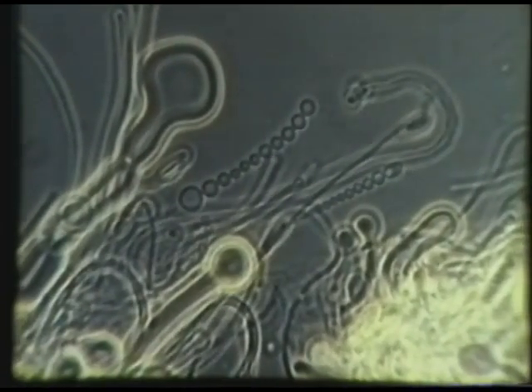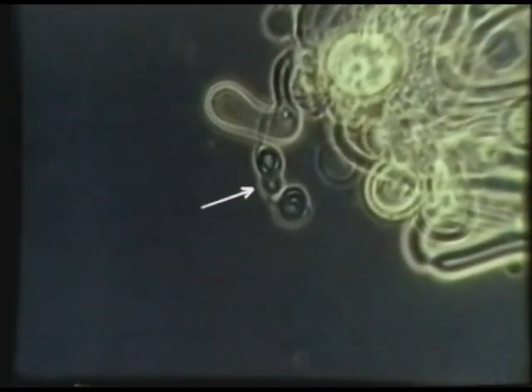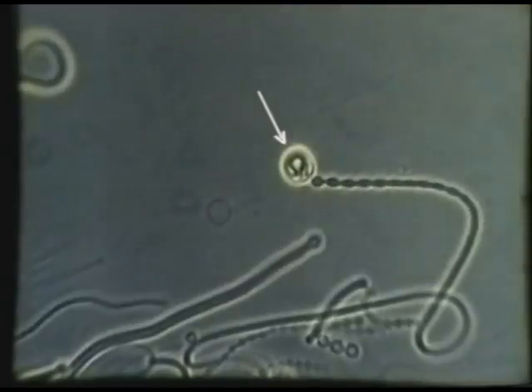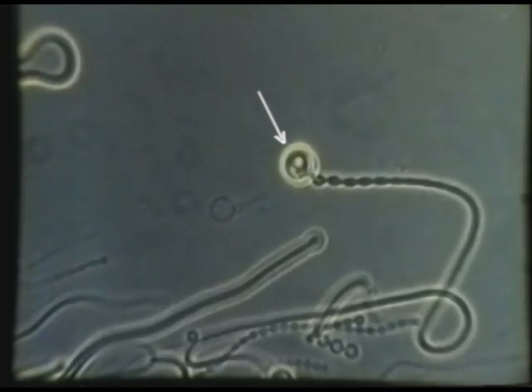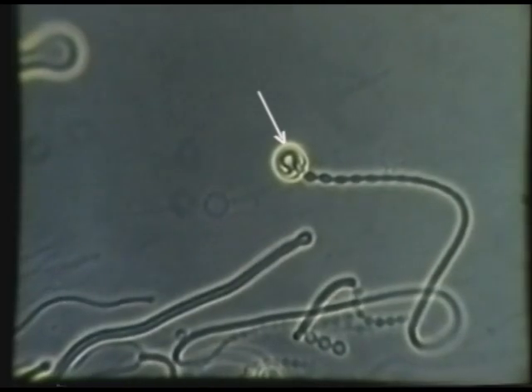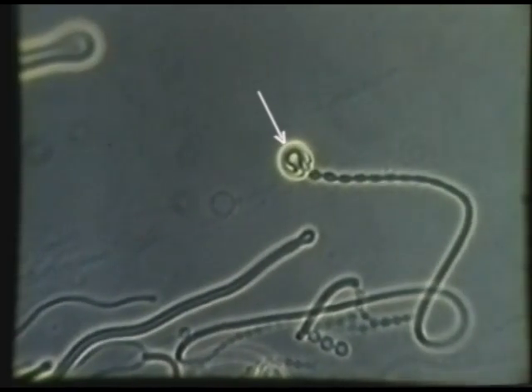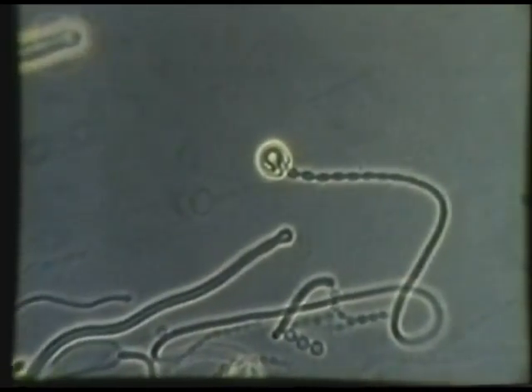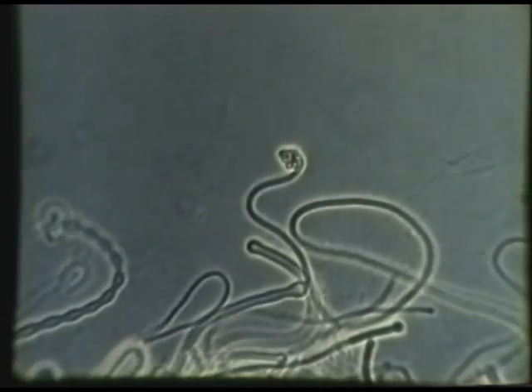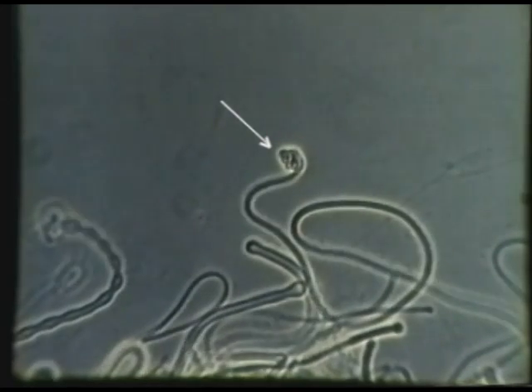Indented circular whirls seen at the lower left margin of the lipid mass are formed by intussusception of interconnected vesicles. The process involves multiple invaginations of vesicles. The bulbous tips of myelin figures are sometimes formed by coiling or twisting at the distal end of the figures.